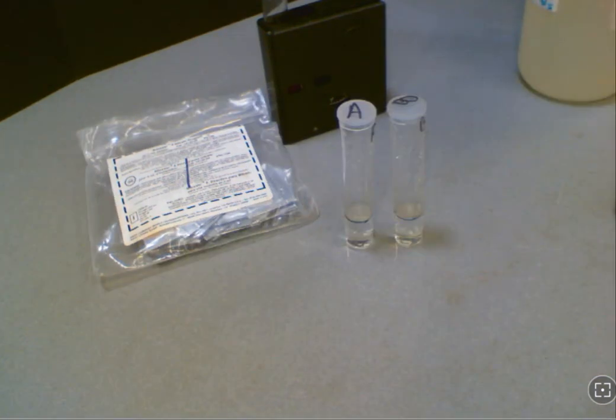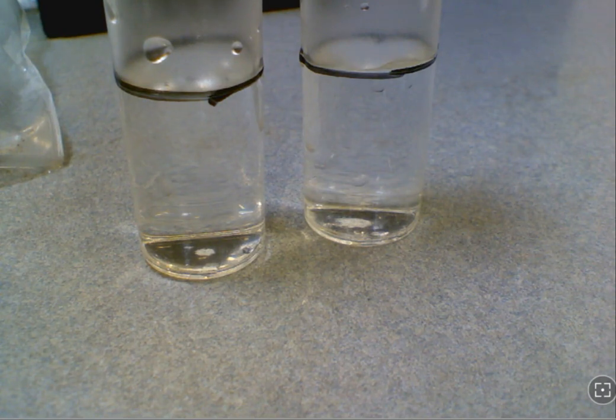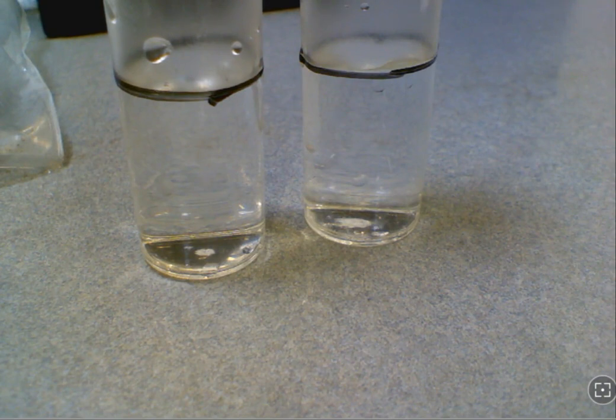After the three minutes of mixing you're going to let the test tube sit for 30 seconds. At this phase in the directions you're going to be looking for particles of unoxidized cadmium metals. This is a hazardous material and it'll be very obvious if it's in there. Most of the time we don't find those particles, so if you don't see anything it's okay.